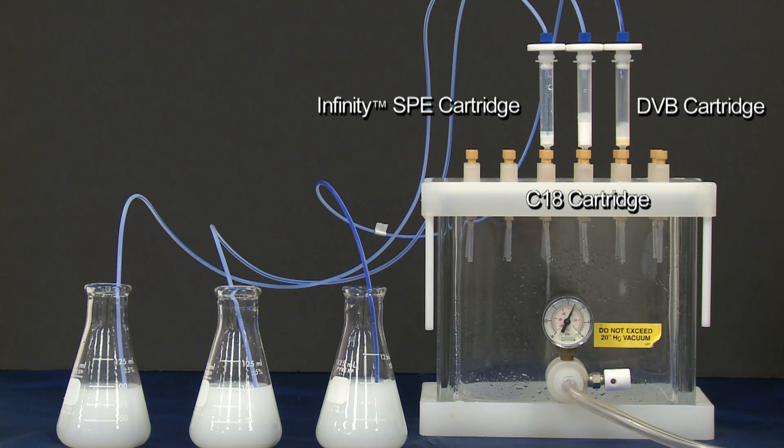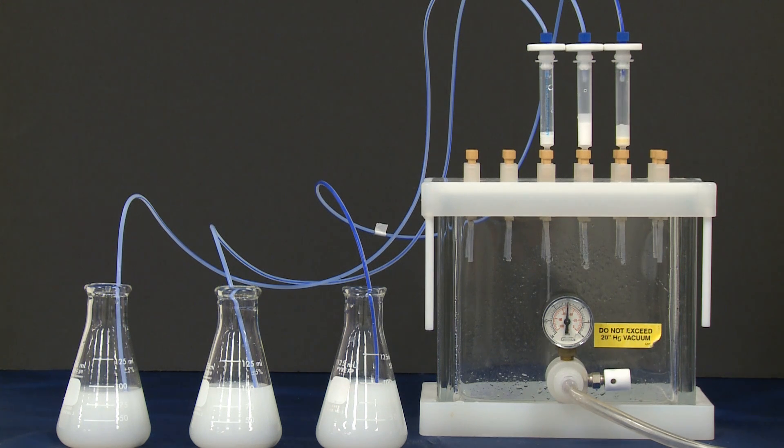All three cartridges have been pre-conditioned. A sample of water has been prepared with a total suspended solids of over 1,000 milligrams per liter.